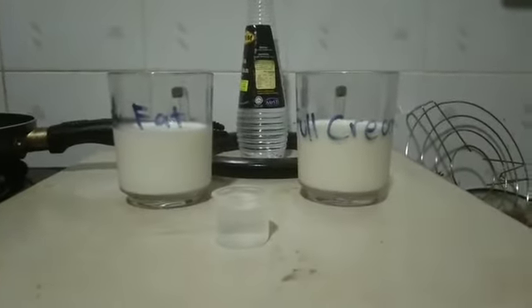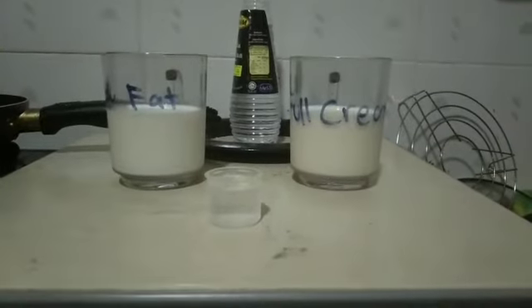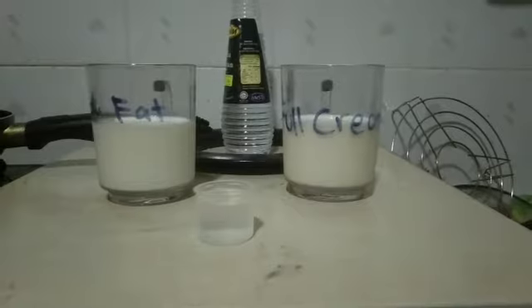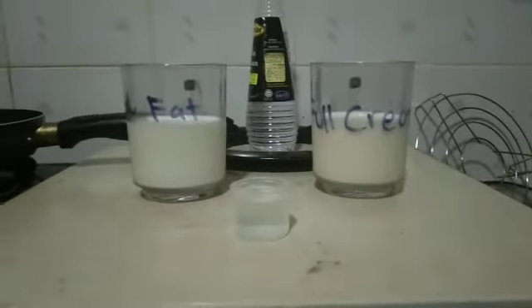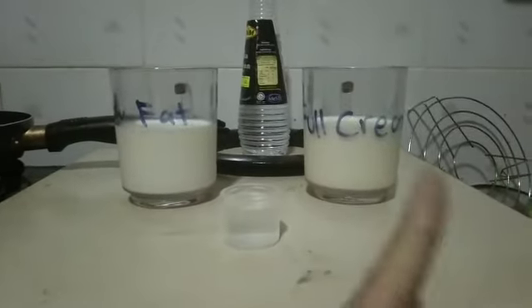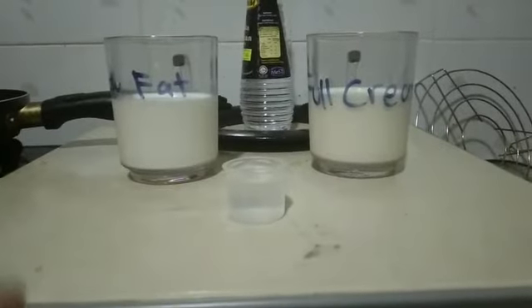Okay, hello guys. Today I will conduct an experiment about precipitating casein from milk. First we have a low fat milk and full cream milk, and we will use white vinegar. Why will we use white vinegar?